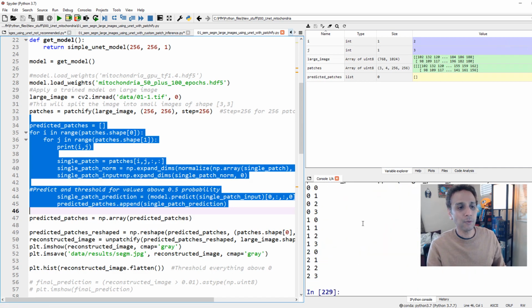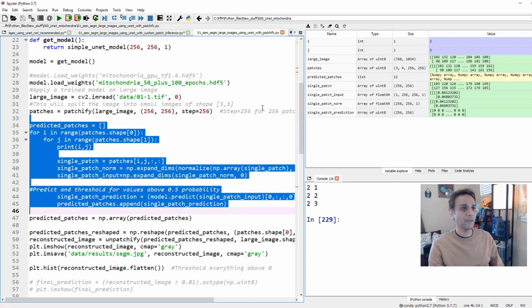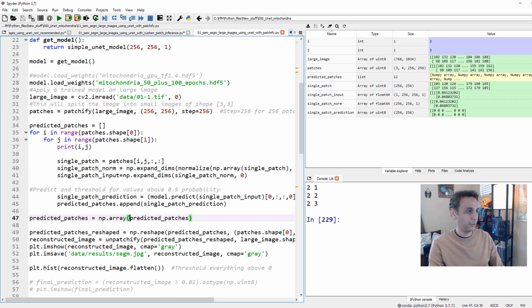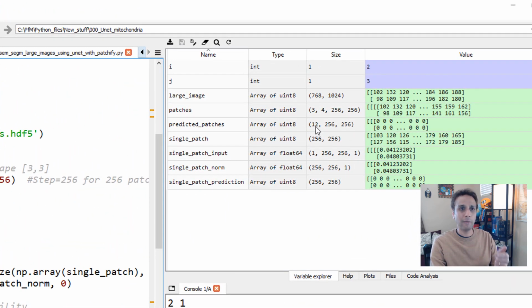And at the end of this, what we should see is, if you look at predict patches up here, it's a list of 12. We have 12 patches. Let's convert that to a NumPy array and reshape it. That's what we are going to do next. So my predict patches is a NumPy array right there. You can see I have 12 patches, each 256 by 256. This is my result. Let's reshape to 3 by 4.